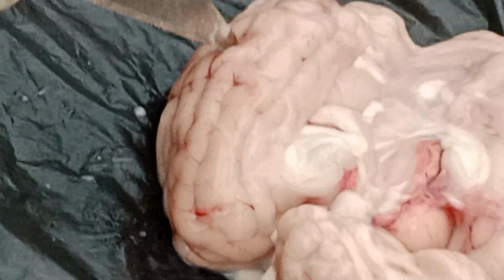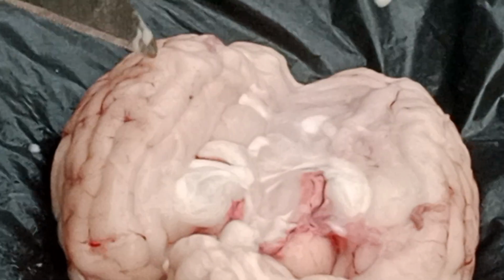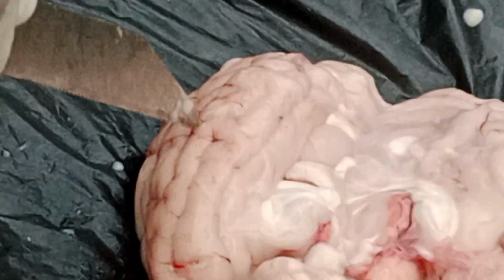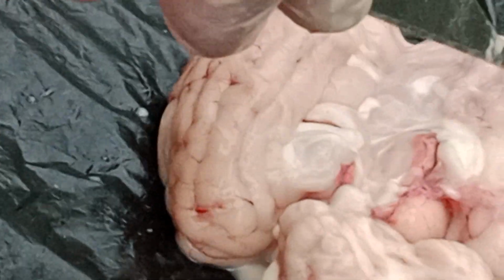See how easily it enters, but here it is not entering. Can you see the difference, children? I am only pressing. Don't think that here sir is not pressing and here sir is pressing. Just the same amount of pressure I am giving. Here it is not going in, and here, you see, it is piercing. So that much soft it is.